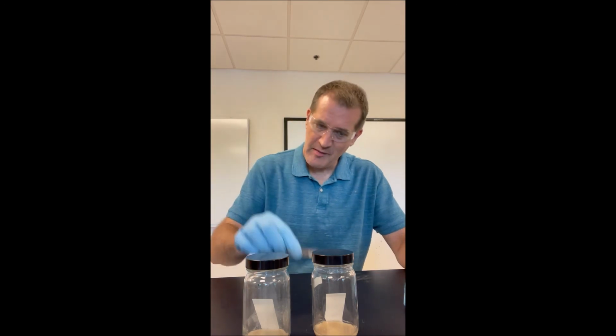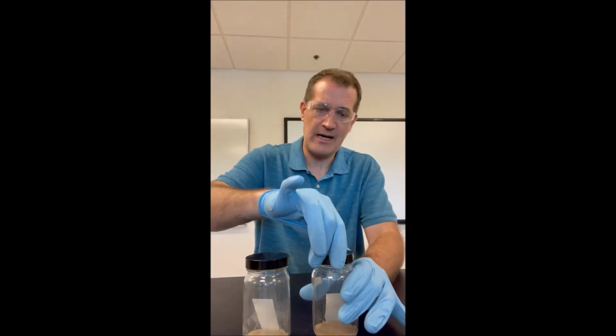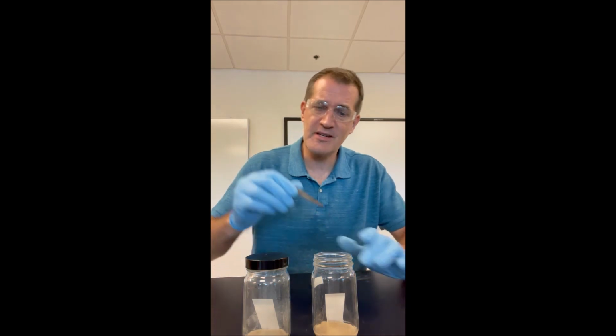Goodbye. So I just showed you guys the 2 TLC plates being put into their TLC chambers. Time has elapsed. The solvent's gone all the way to the top line, at least on this first one. So I'm just gonna take it out.